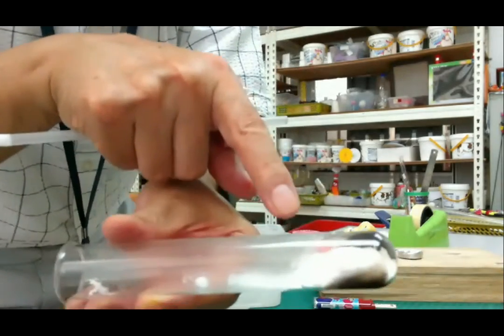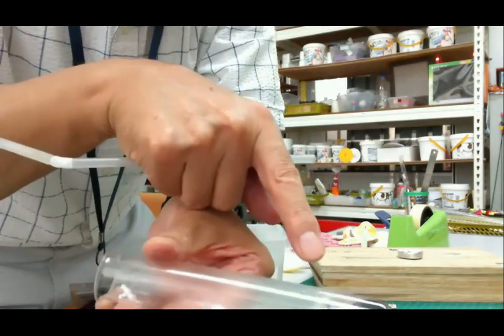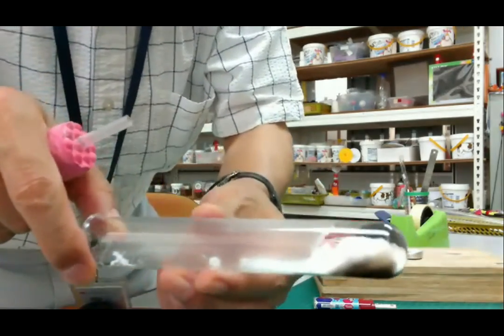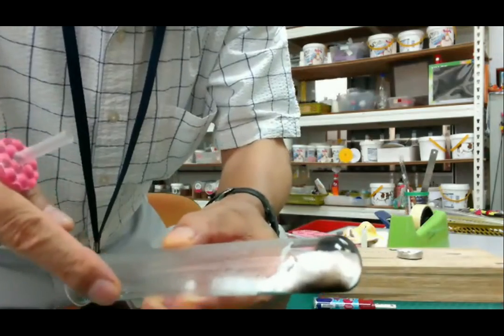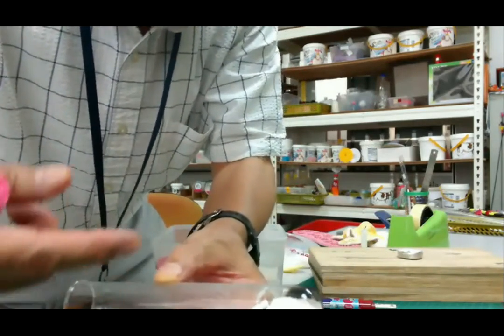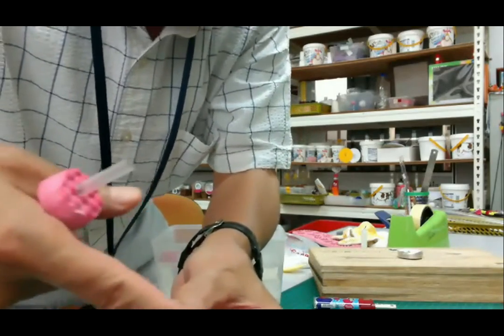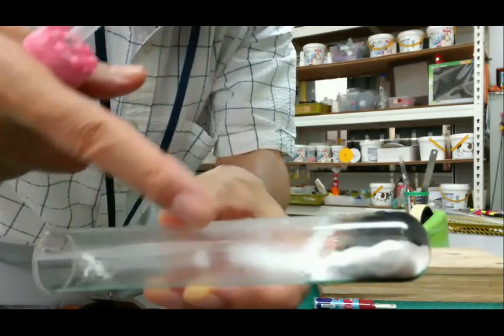Then one more thing, after heating, can you see? After heating, this is the white one. This is the sodium carbonate, white powder. Okay, this is the sodium carbonate. And you can see the small water around here. So this baking soda produces carbon dioxide and water. Around here, some water just sticks on the inside of the test tube. Can you see?